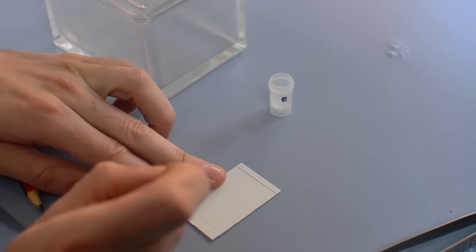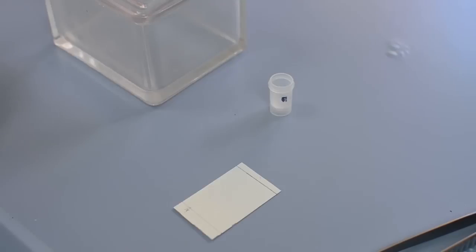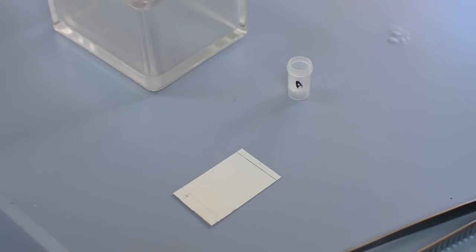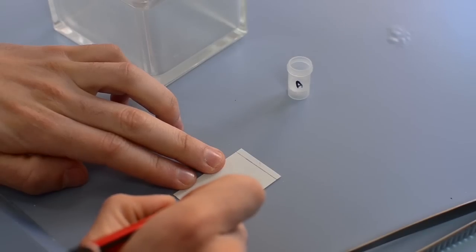Spot a diluted sample of your mixture onto a TLC plate which is slightly wider than normal. Spot samples of the suspected pure components just next to the mixture spot.